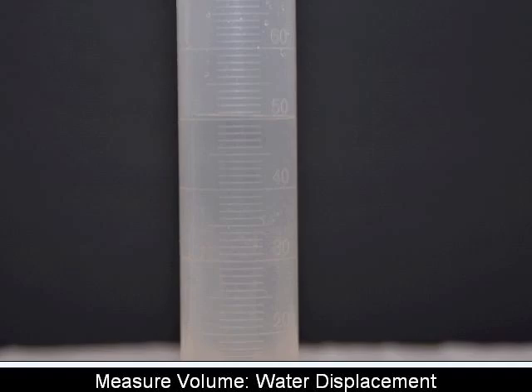Okay, now let's use the water displacement method to calculate the volume. And here you can see I have a graduated cylinder filled up and has some water in it right around the 50 milliliter mark, between 50 and 51. I'll let you estimate a decimal place there. So between 50 and 51 is where that water level is, and you can just read that line right there. That's the water level. So estimate a decimal place. Is it 50.1, 50.3? What do you think that is? And record that result.